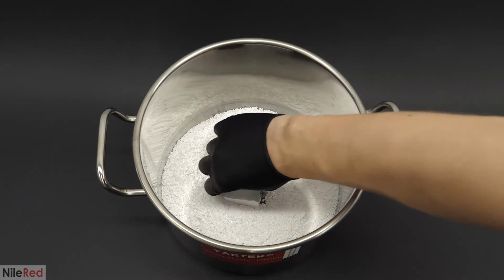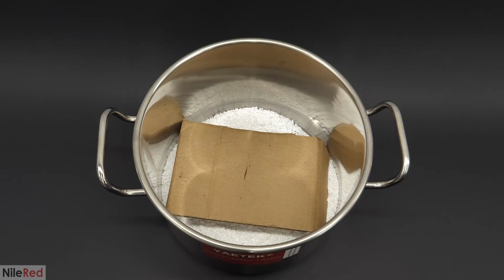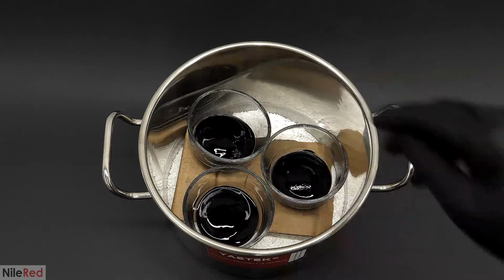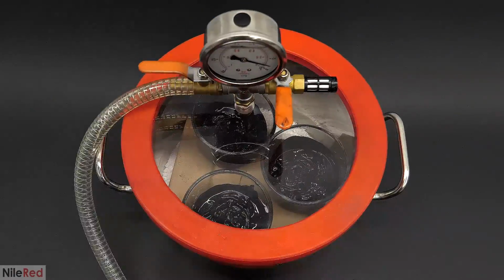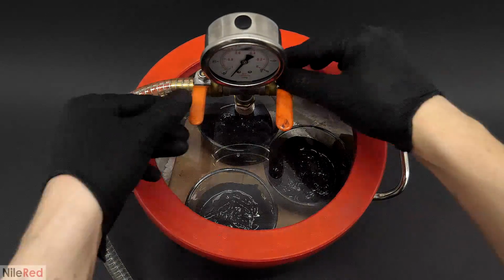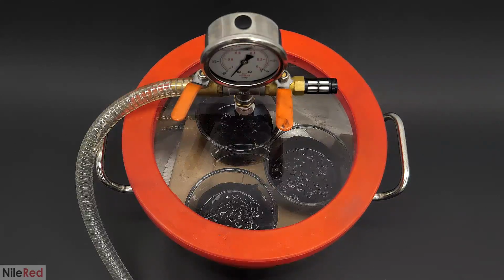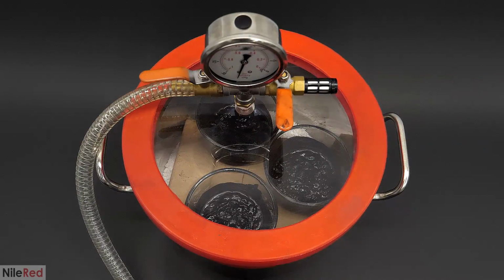So now to the chamber, the first thing to do was to dump in a decent amount of the calcium chloride. And then on top of this, I made a small platform using styrofoam and a piece of cardboard. I put in all the bowls with the magnetite, and I also mixed them around a bit. Then I closed the chamber and I turned on the pump, but I didn't let it go to a full vacuum because sometimes this can cause things to splatter. I instead went to a certain point and then left the valve only slightly open so that the pressure would slowly decrease. By the time that it got to a full vacuum, it looked like it was behaving itself, so I fully opened the valve.